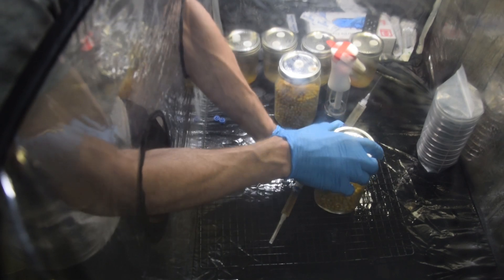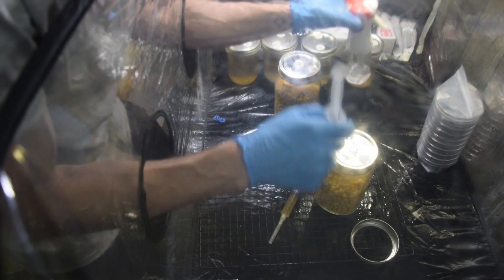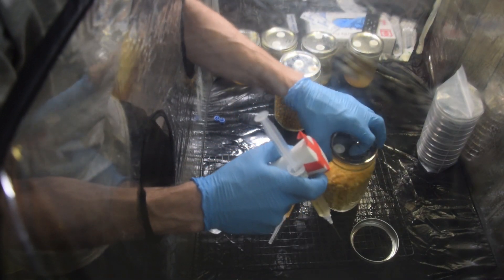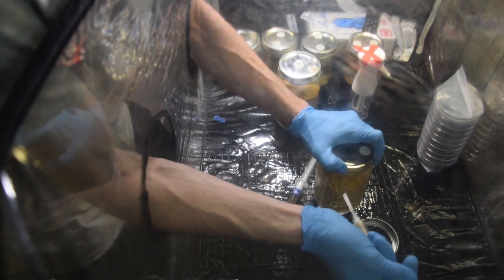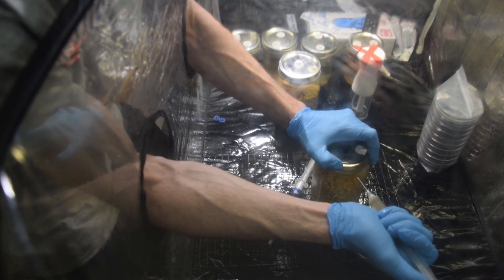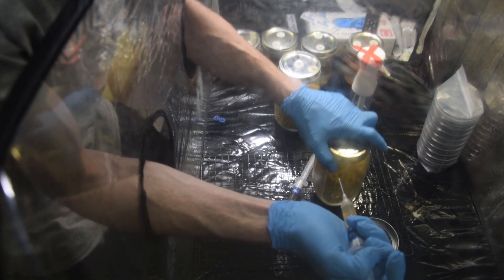These ones I've already sprayed. Typically what I do is take the ring off. I get extra paranoid at this part — the part underneath the ring never got sprayed and probably has germs under there. So I'll just quickly spray around the edge of the jar again. We're just going to crack it a little bit and give it a cc or so. I know I squirted some into it — I actually couldn't see there, I hope you guys could with the shadows.